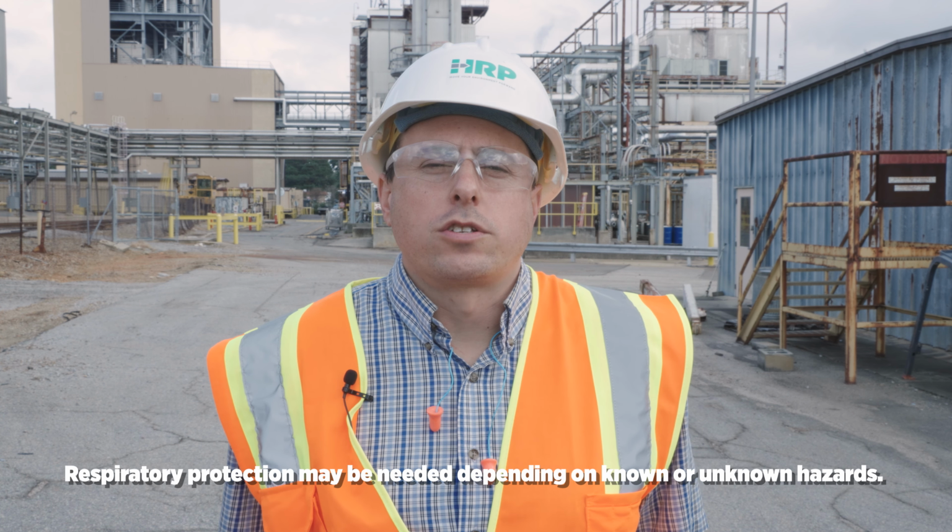Now we will be filling out the chain of custody for the unknown waste that was collected earlier. Company name, ABC Corporation. This is an example chain of custody as we are protecting our client's business confidentiality. The address, the report to, so this is the person that we want the results to be reported to. A copy of the report, we want to go to a second person.